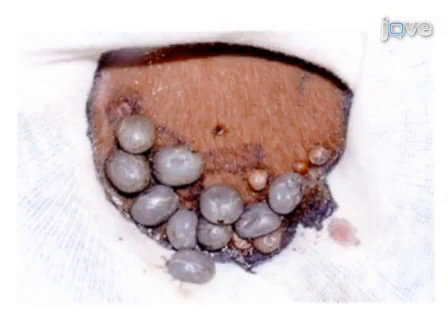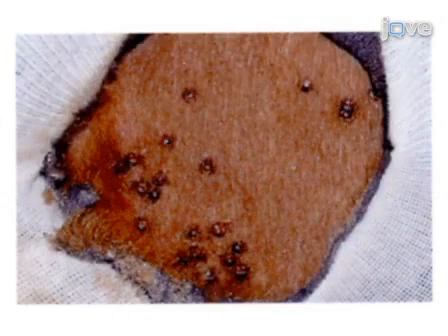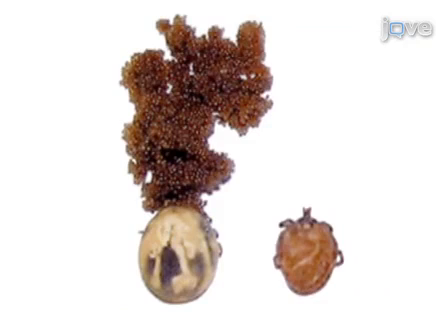Finally, tick feeding parameters, such as weight, molting, and oviposition, and the expression of the targeted gene or genes of interest by real-time RT-PCR are determined. Ultimately, results can be obtained that demonstrate the effect of silencing targeted genes on tick biology by evaluation of tick biological parameters and gene expression by real-time RT-PCR.